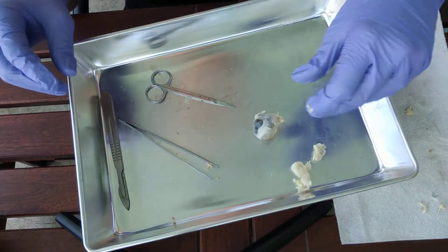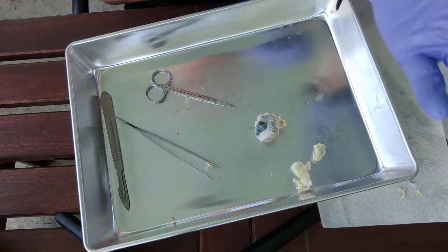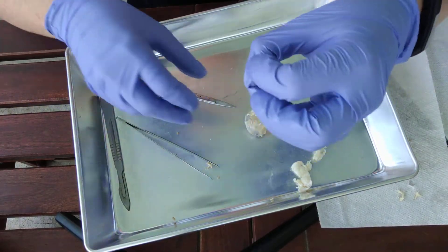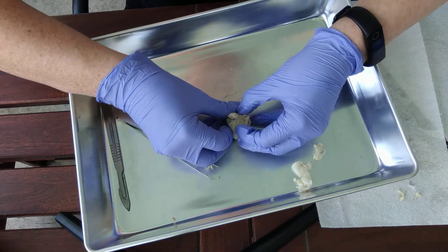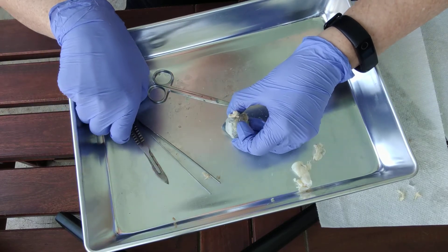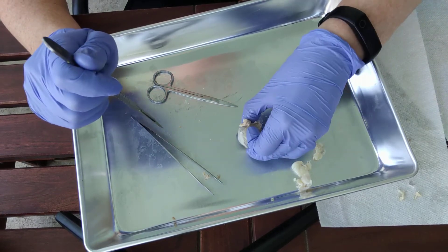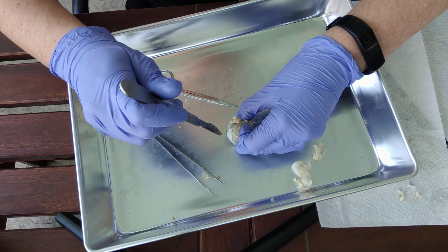Now we're going to cut into it. Because the eye is so small, round, and hard to hold onto, you need to be very careful. Whenever you are cutting, use your octopus hands — keep your fingers out of the way, hold them in tight and close together. Always cut towards the tray. Hold the specimen on the tray. Do not cut in your hands ever.